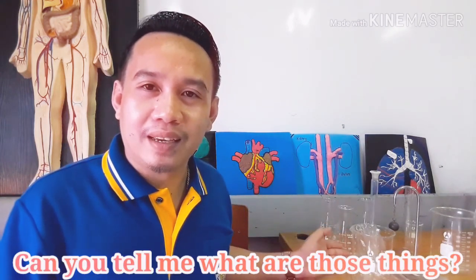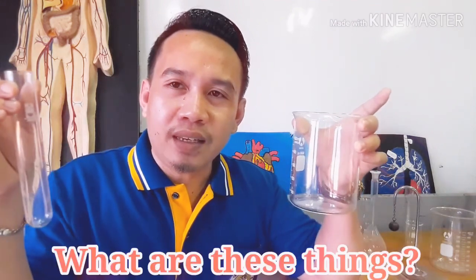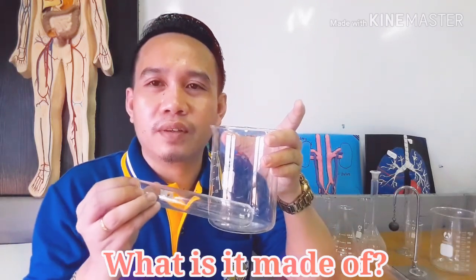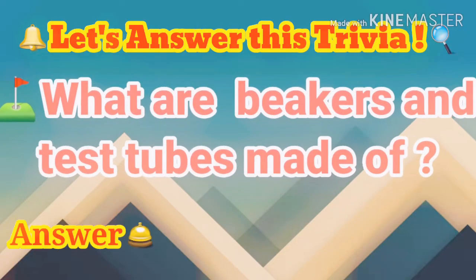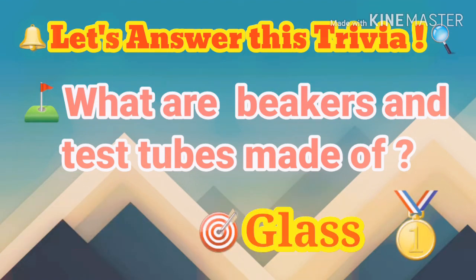Are you familiar? What are these things beside me? I'm going to take this. Do you know what are these? What is it? What about this one? What do you think it is made of? Is it plastic, metal, paper, or glass? What type of ware is this? Is it a plastic ware, glassware, metal, or paper made of wood? It's very clear — it's made of glass.